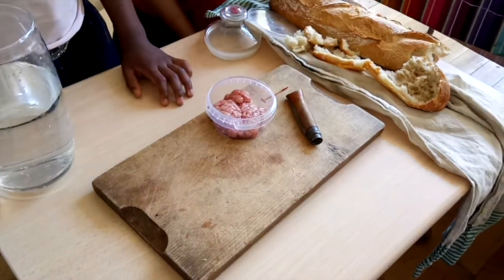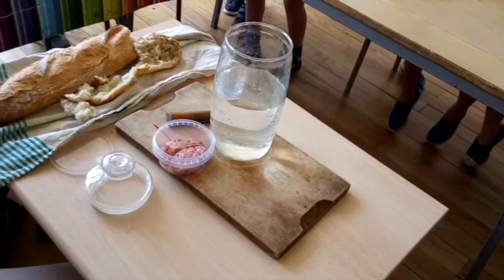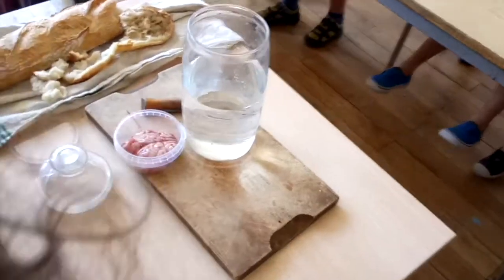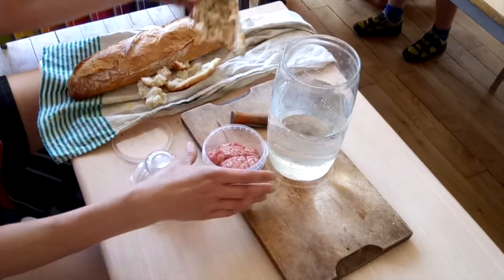What else did we have planned? We put it in the water. It's a very delicate operation. But no — attention. We can do it like this. We can do it by steps.